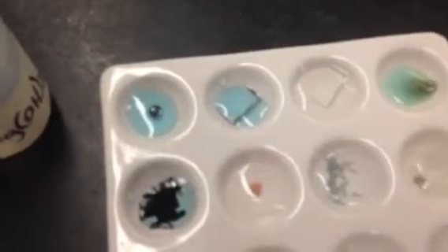Then we've got magnesium with calcium chloride. Sorry, my camera work is jiggling around here. I'll straighten you out so you can see everything in a minute. So this one is the magnesium and calcium chloride. And then we've got the zinc nitrate is going to go in here with copper. There. Oh, sorry, this was the copper with zinc nitrate. That's the last one on your list.